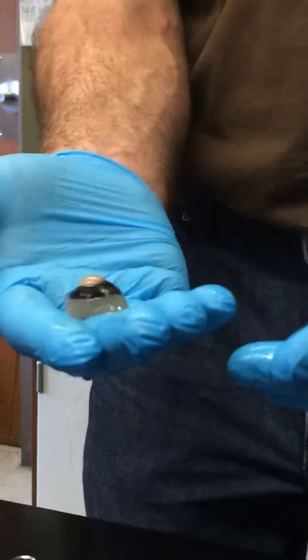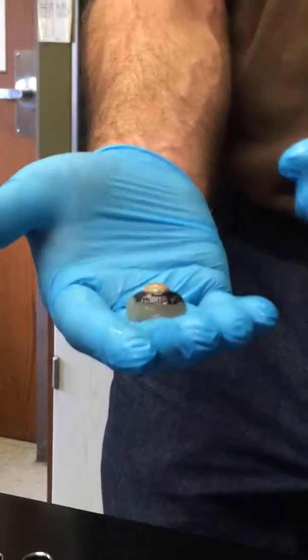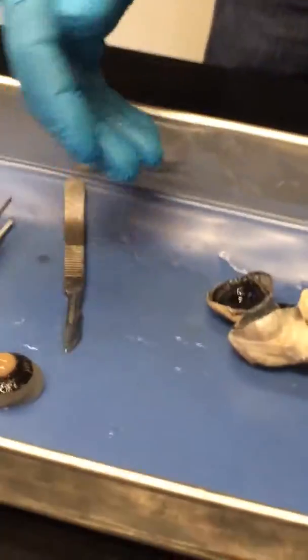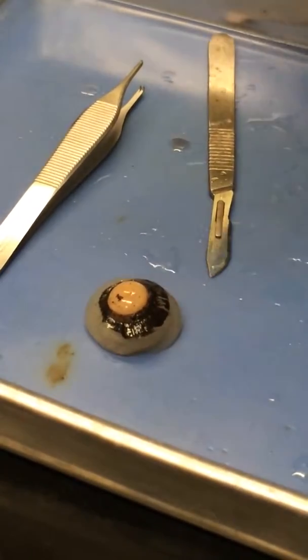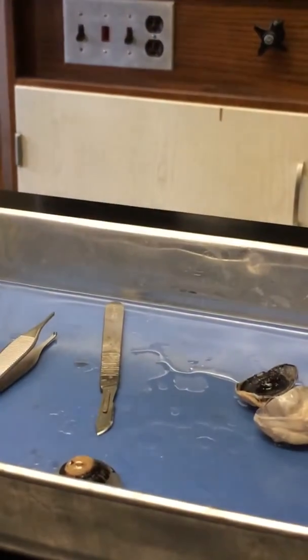It's really cool. I wish I had a fresh eye for you, because if anybody goes fishing or anything like that and you actually dissect a fresh eye, the lens is a functional lens. They don't just call it a lens for nothing. So there's the lens and, well, it's fixed at this point too. This is all preserved tissue. So I thought it would just kind of ooze out. I don't know. And again, the vitreous here is all cloudy, and it's not something that you can see through. But in a fresh eye, the vitreous humor is crystal clear.